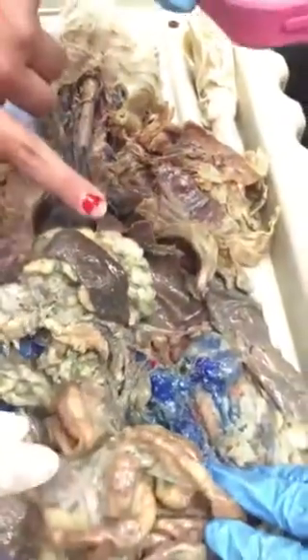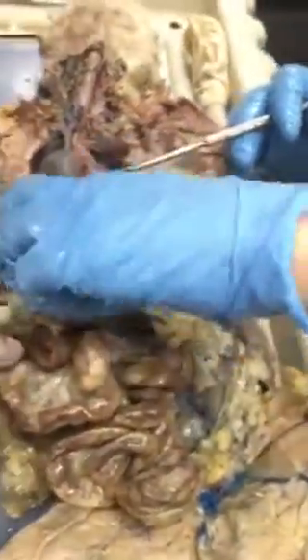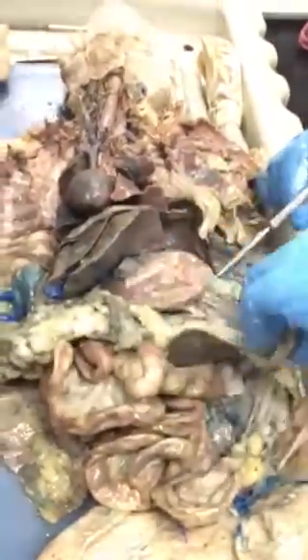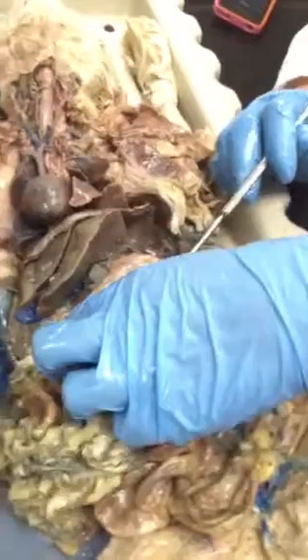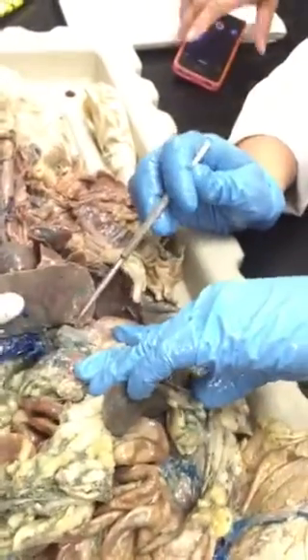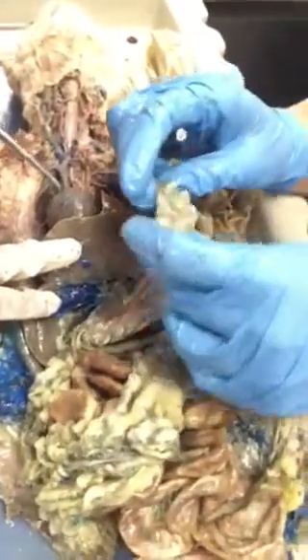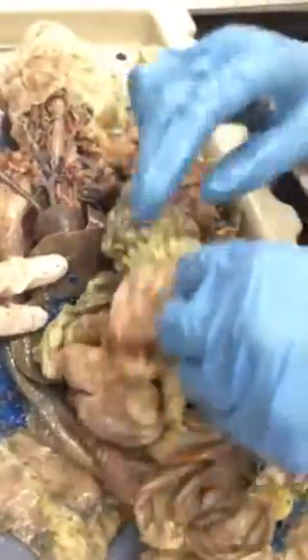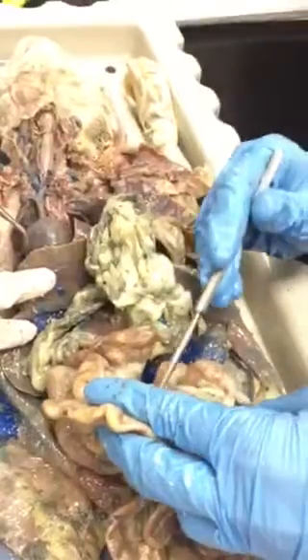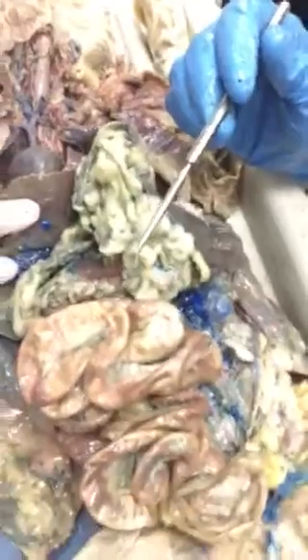Dr. Logan, what is this fat stuff called again? Okay, so overall, you have stuff called omentum, and this is all omentum. They call this the greater omentum because it comes from the greater curvature, and the lesser omentum comes from the lesser curvature of the stomach. But it's a bunch of areolar connective tissue plus fat. Now, that turns into what we call mesentery. The mesentery is the stuff in between all these intestines, which is why it's the superior mesenteric artery.